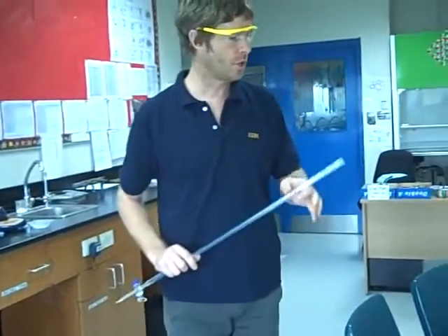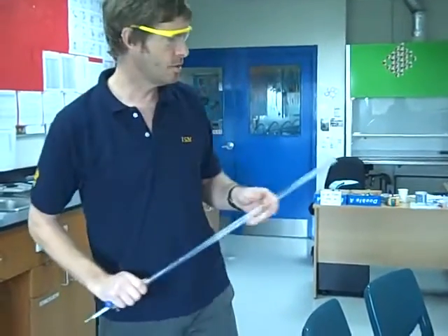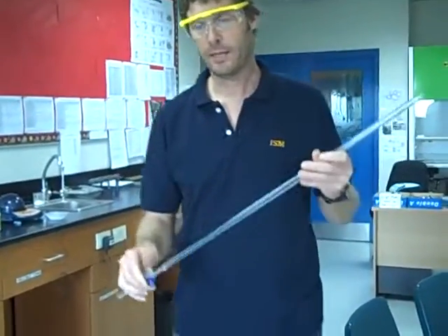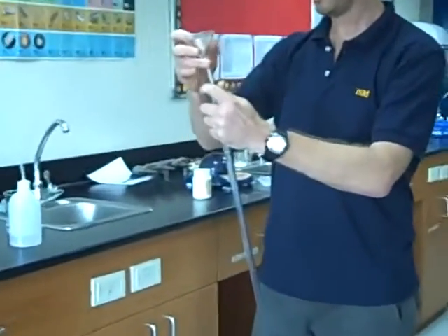So now the next thing is you are going to run the oxalic acid out of your burette into your sodium hydroxide solution. But first of all, we need to prepare our burette. It needs to be clean. We're going to clean it first with some tap water.